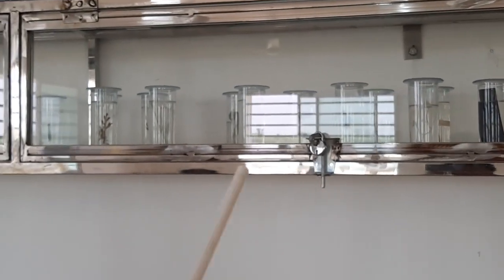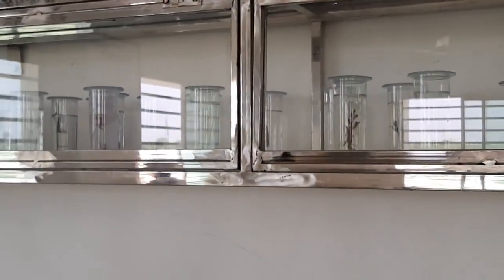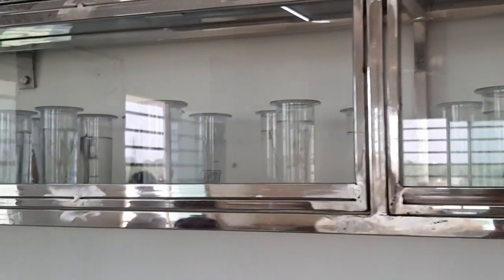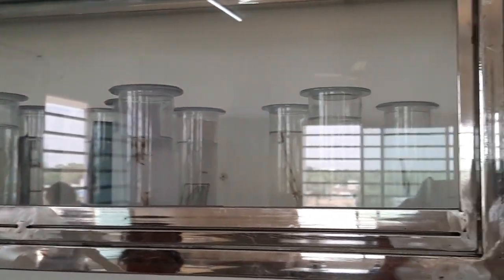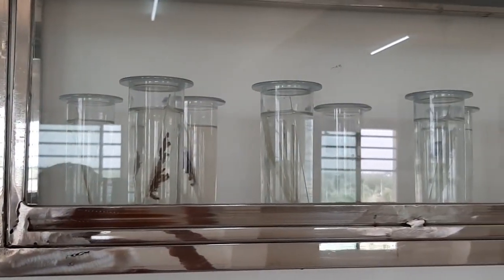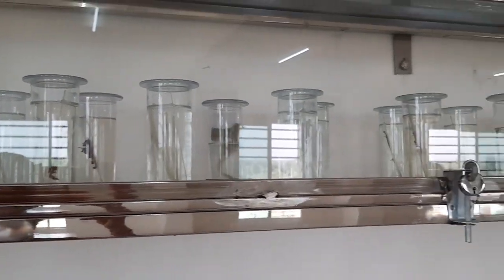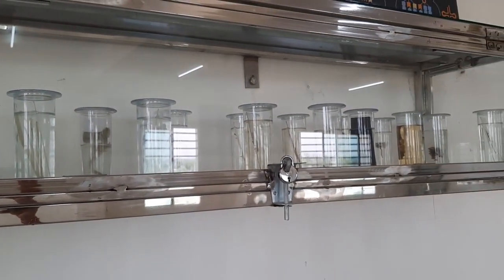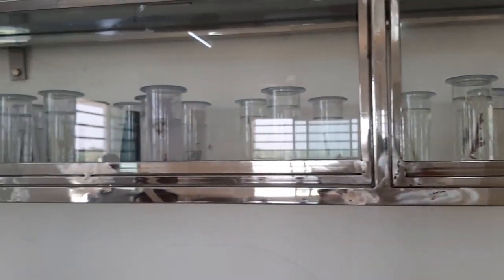These are the specimens of plants. Previously we saw the animal specimens; now these specimens are of plants. These include aquatic plants, as well as terrestrial, xerophytic, and mesophytic conditions.